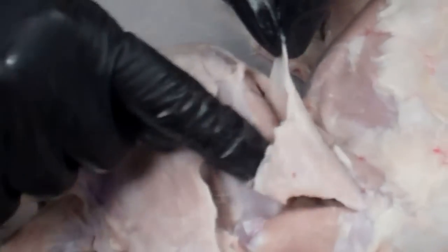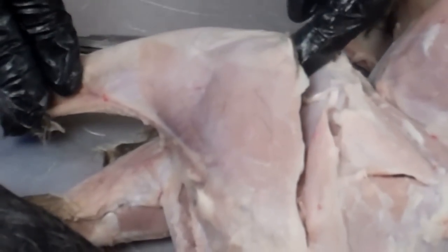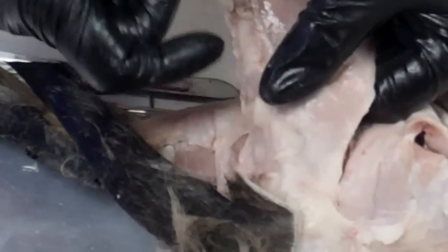We'll have to wait until we get on the inside on the other side to completely free it up, but you can see most of it right here. The next thing we're going to do is free up the biceps muscle — this is called the biceps femoris, so that we don't confuse it with the one on the arm, which is the biceps brachii. In order to do this we want to make sure that we don't do anything to the sciatic nerve, so we're going to look underneath here for a white cord — we don't want to cut that. Then we're going to go to the back and remove that glob of fat back there.